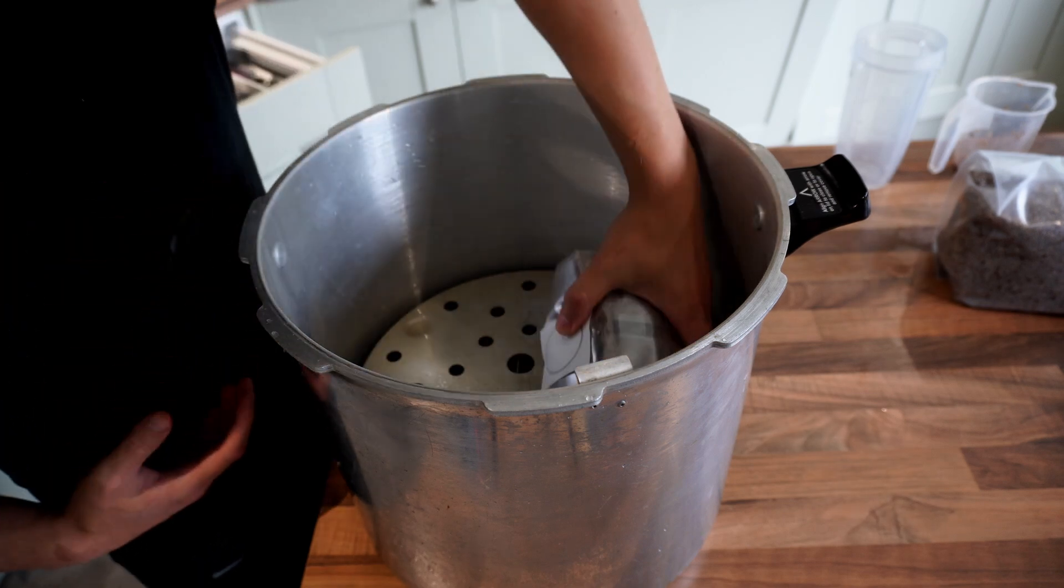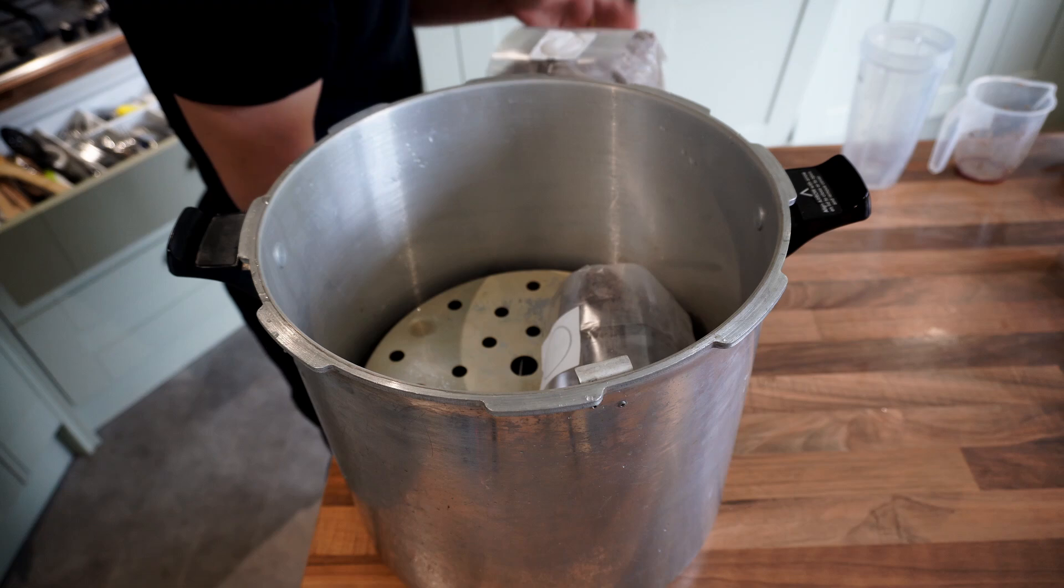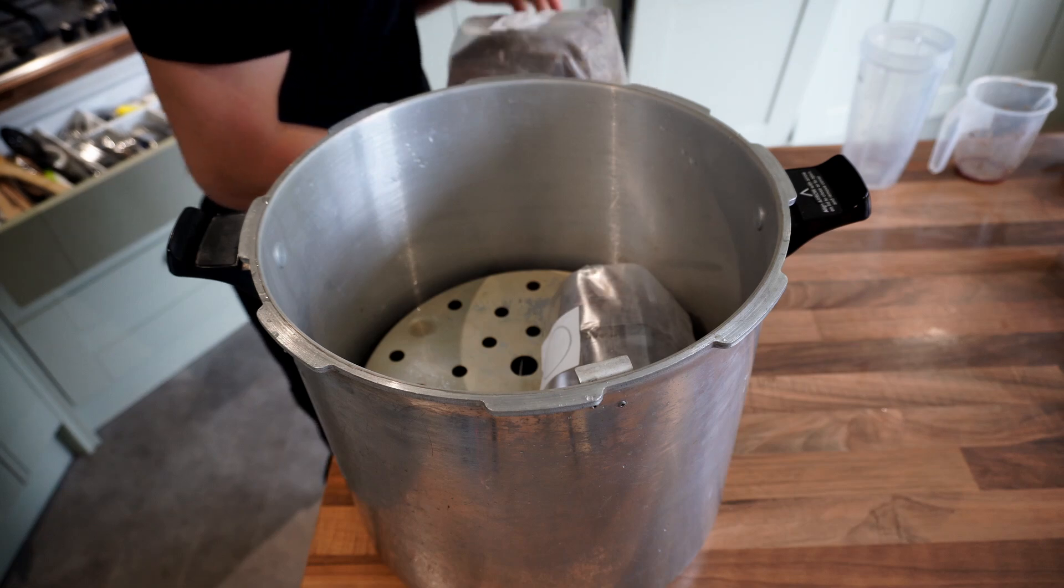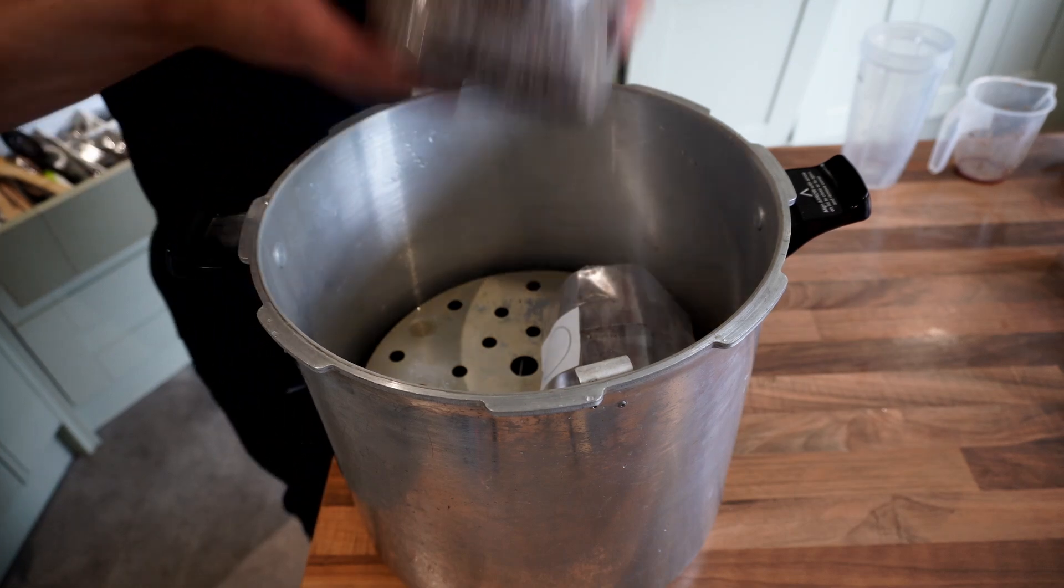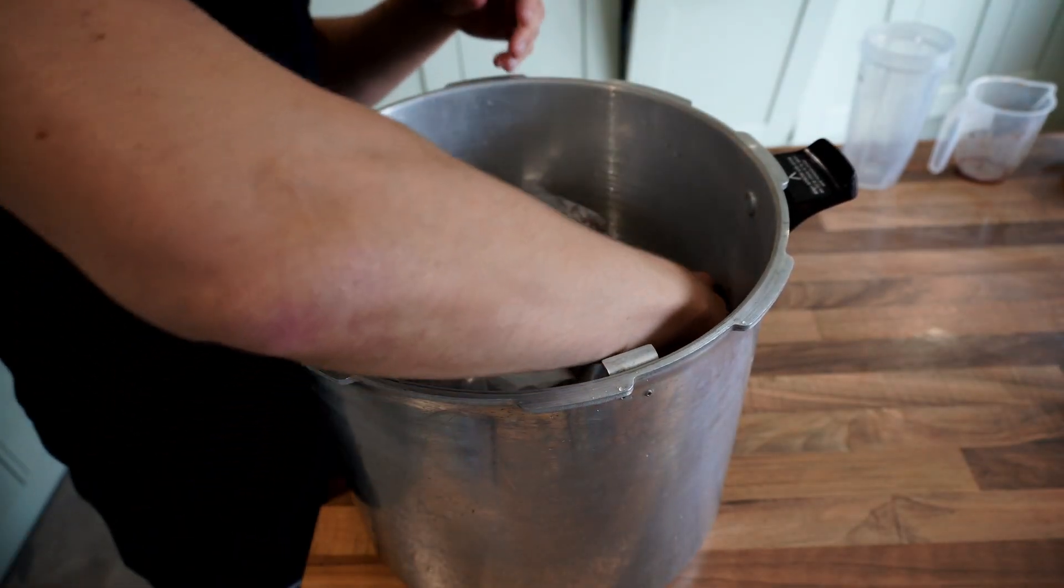Make sure the way you stack the grains inside the pressure cooker keeps the shape and keeps the top of the bag folded under because you don't want it to lift up and block any of the safety mechanisms and that is honestly the best way to make sure that the bags seal.